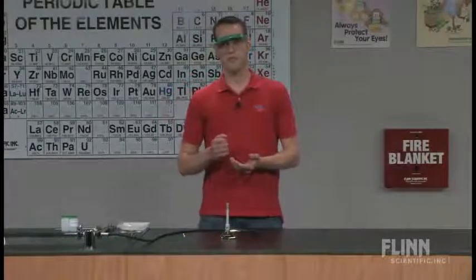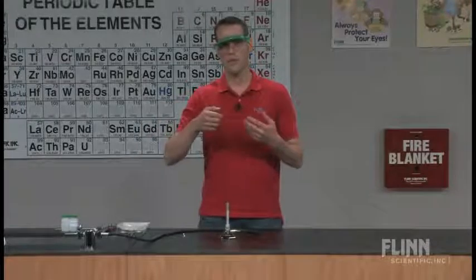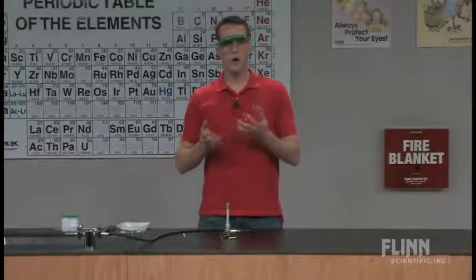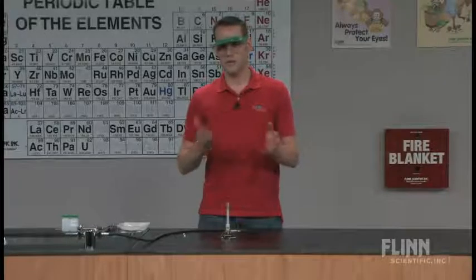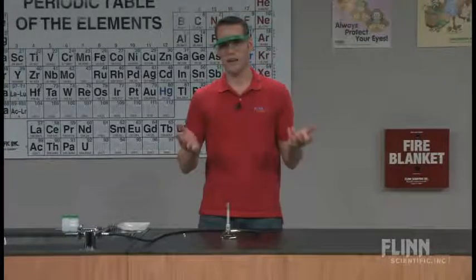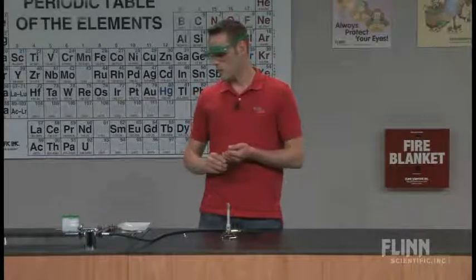Now the recipe that the teacher gave me before called for mashed up bananas and then they take it, scoop it, and put it in the flame. I found that that worked okay, but then I had this mess of a banana goop and I have to do this over two days and there are fruit flies by the next day. And I just found it a pain to deal with.